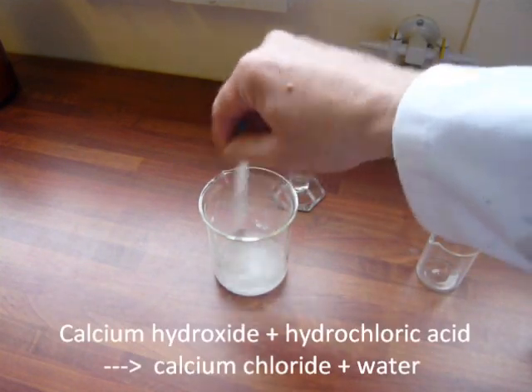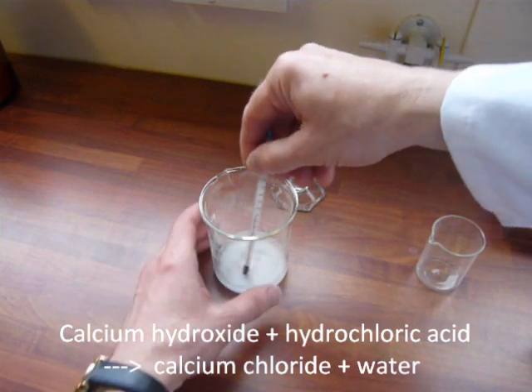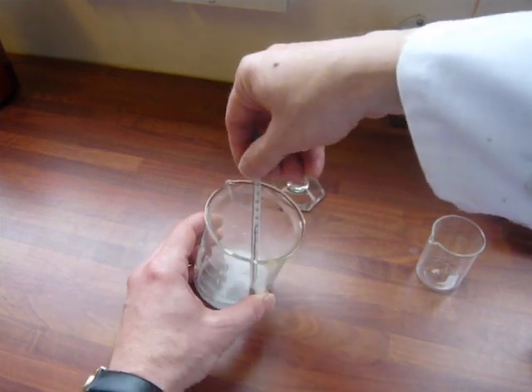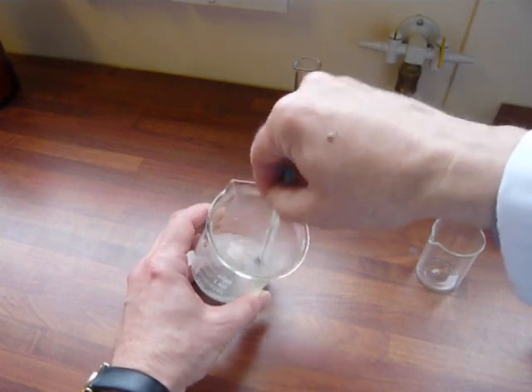Give it a good stir, and the temperature has already risen to about 28 degrees C, so it's an exothermic reaction.